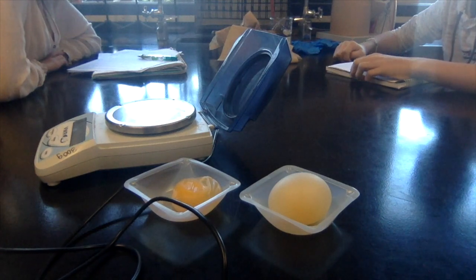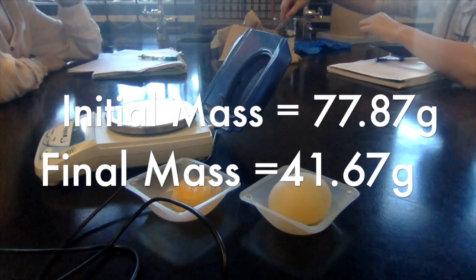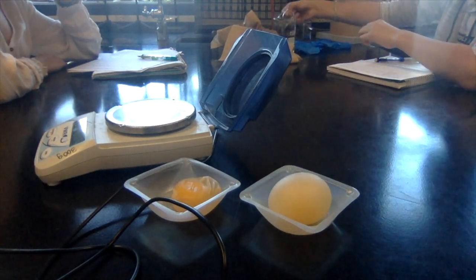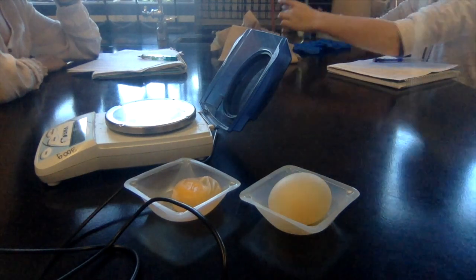Hi. So it's 50% solution. Bring the solution over. Take the cup out of there though, and you can empty the glass into the beaker, and you can put that off to the side. Perfect. Thank you. Bring it on over.